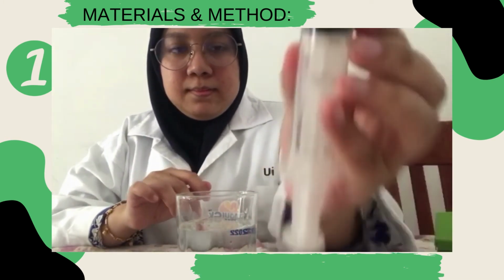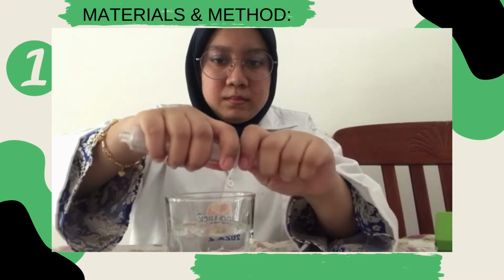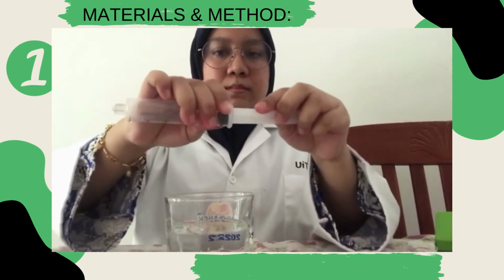When all the leaf discs have settled to the bottom of the solution, carefully remove the plunger and pour the discs and solution into the cup. They should settle to the bottom of the cup. If any leaf discs float, remove them from the beaker.